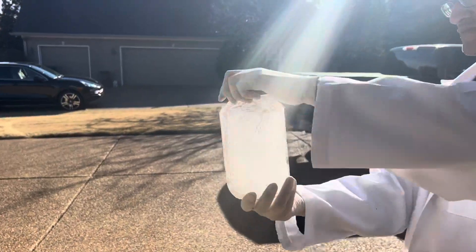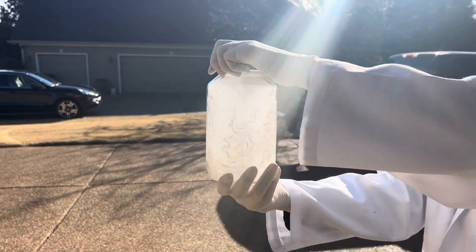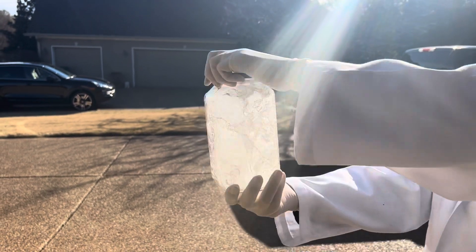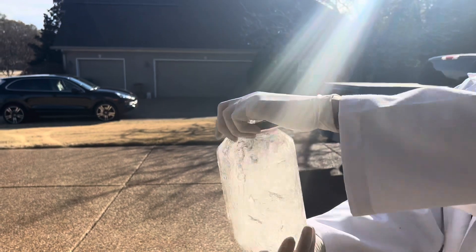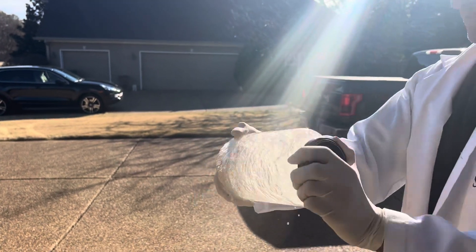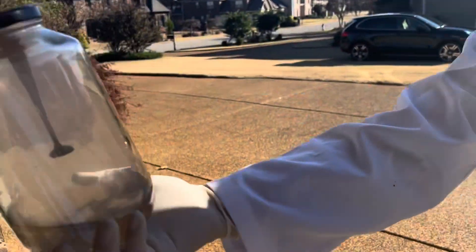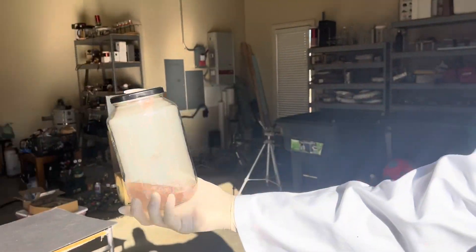See the smoke clearing up? That's the phosphorus pentoxide reacting with the water to form phosphoric acid. Here we go. Now it's mostly clear.